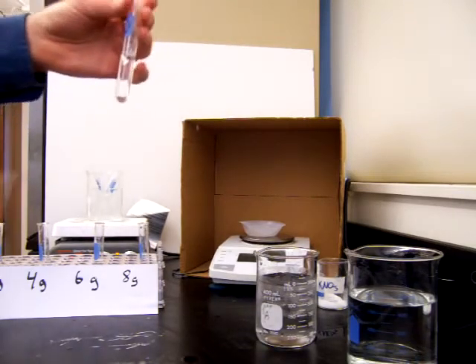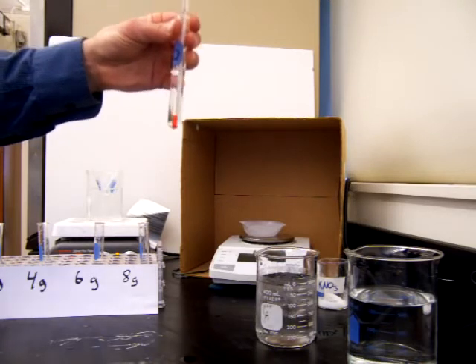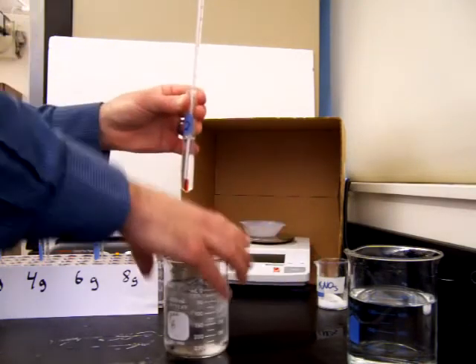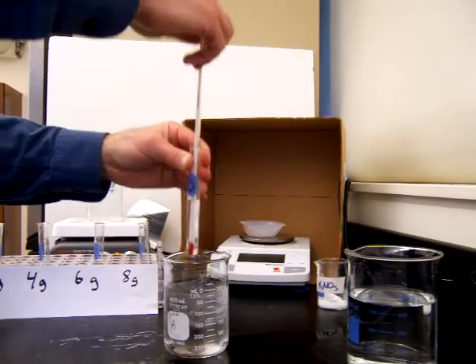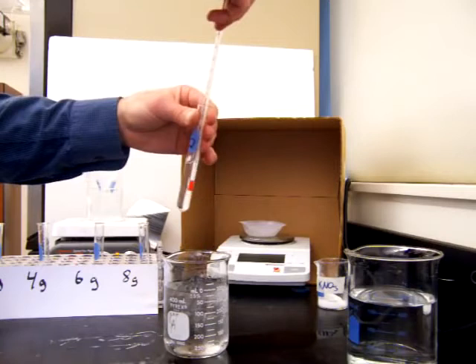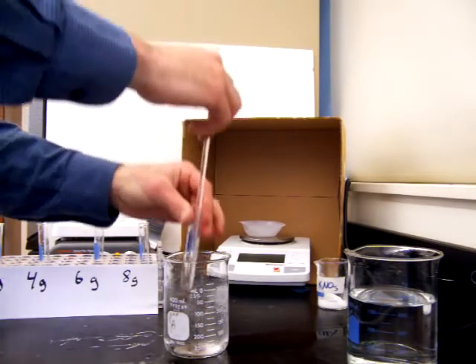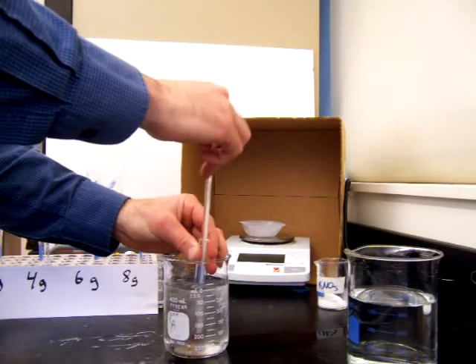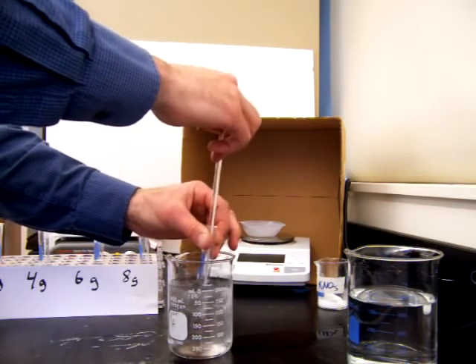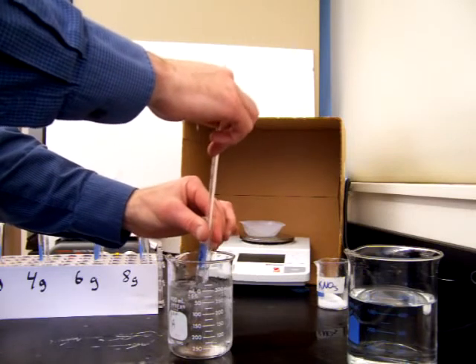So what we're going to do now is stir this and let it cool and see at what temperature the crystals come back out of solution. To speed this up a little bit, we can use a cold water bath. So we have some ice here, and we'll dip this in and we'll stir it a bit, pull it out, we'll see if any salt crystals are forming. So far they have not. This particular solution has the lowest concentration of the 4 we're going to be testing today. This one has 2 grams of salt dissolved in 5 milliliters of water.